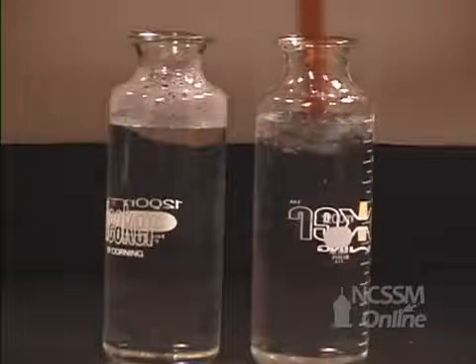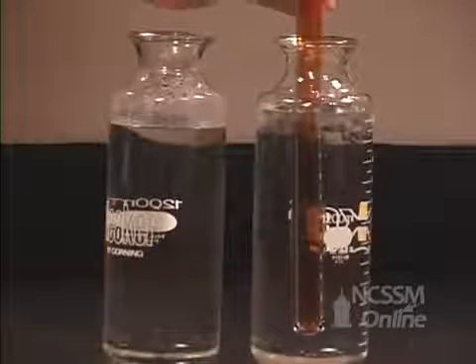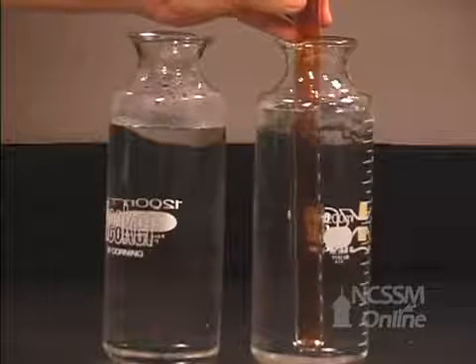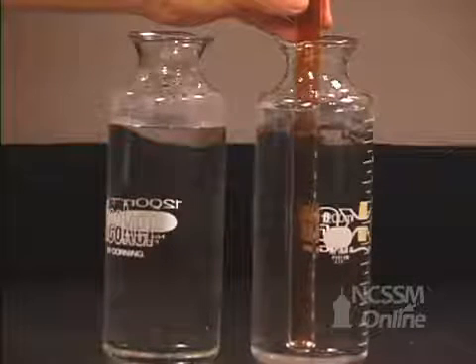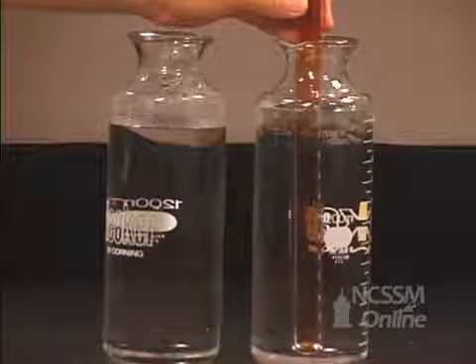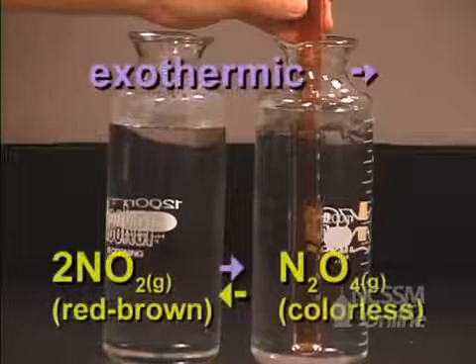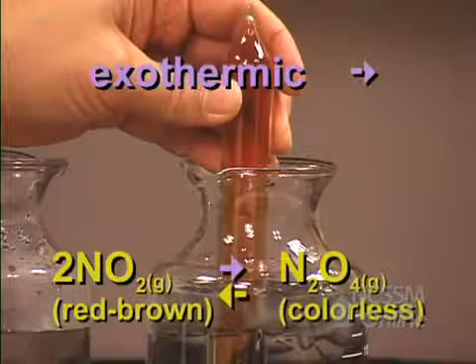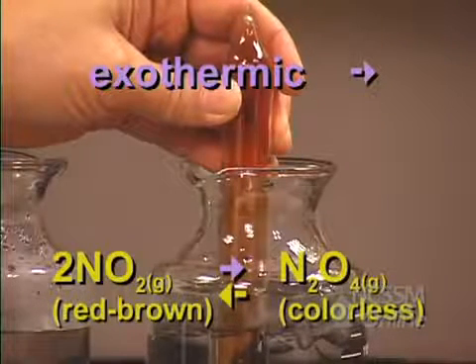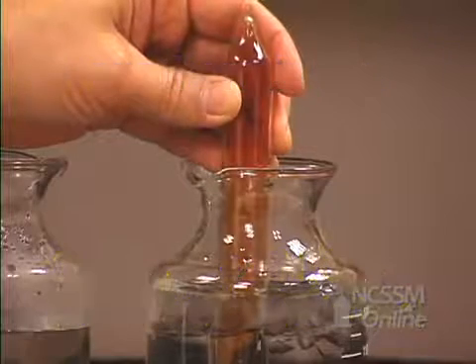We'll place the tube in an ice bath. We notice that the color in the tube gets lighter, indicating that the concentration of NO2 has decreased. This indicates that the equilibrium has shifted in the forward direction towards N2O4. If we cool a reaction, the equilibrium is exothermic in the forward direction.